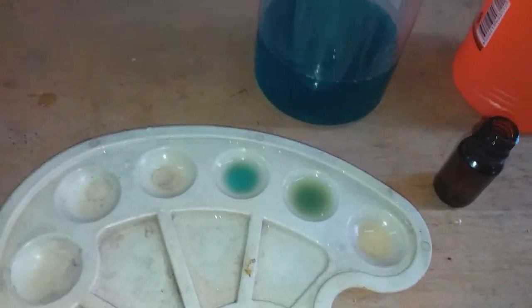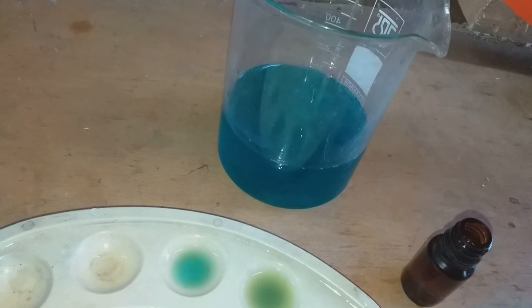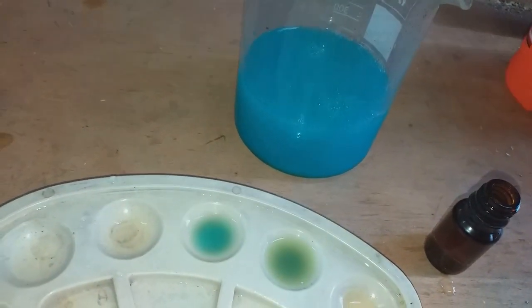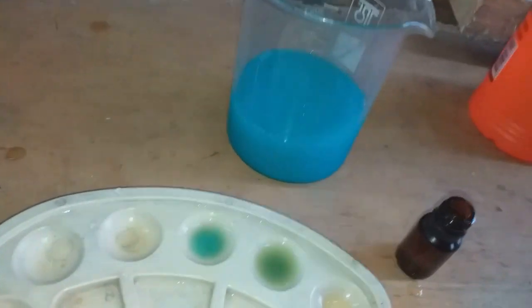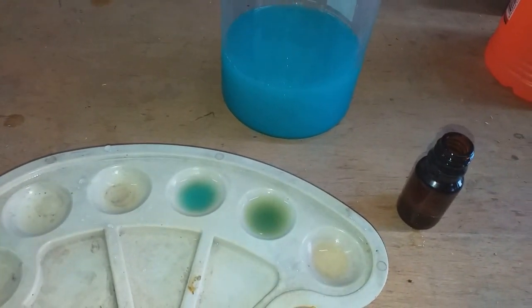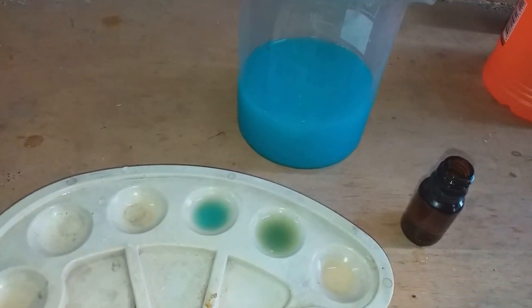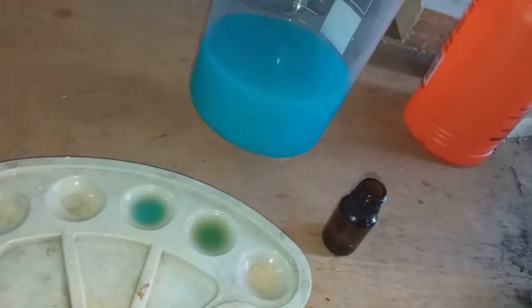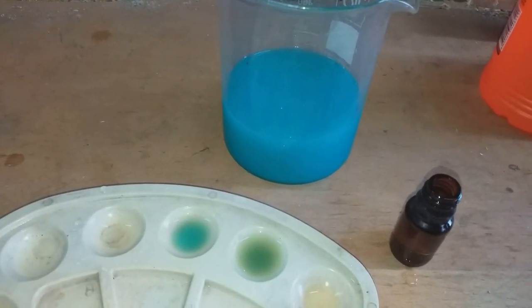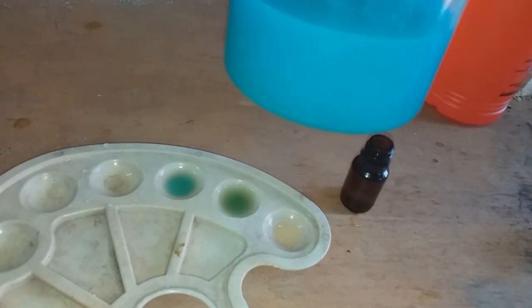Let's add a little hydrochloric acid to the nitric acid solution to see if there is any silver inside. And yes - we got some little silver amount. The solution gets slightly cloudy, but not too much silver there. So this kind of capacitor contains a small amount of silver, but does not contain palladium or other precious metals. Just a little cloudy solution, nothing else.